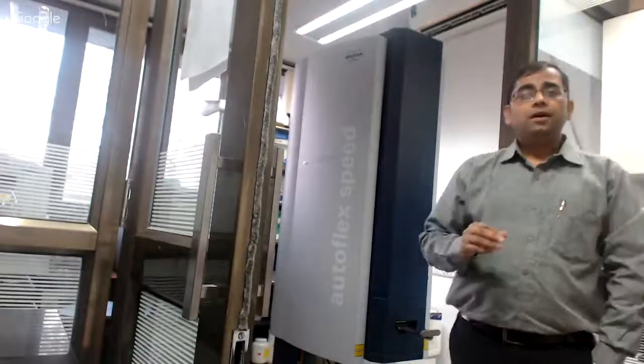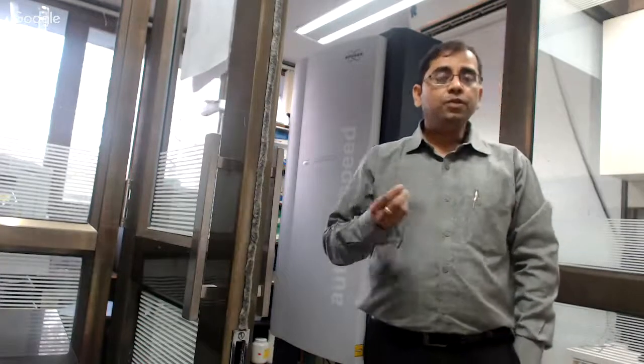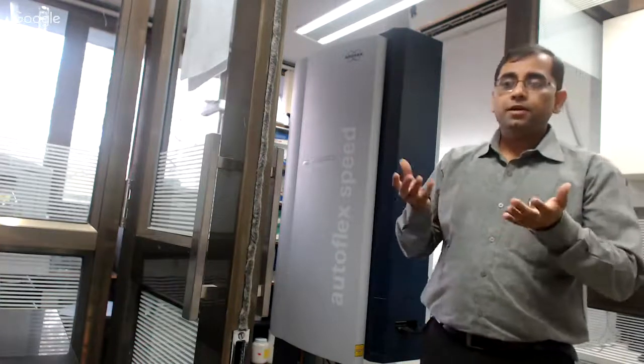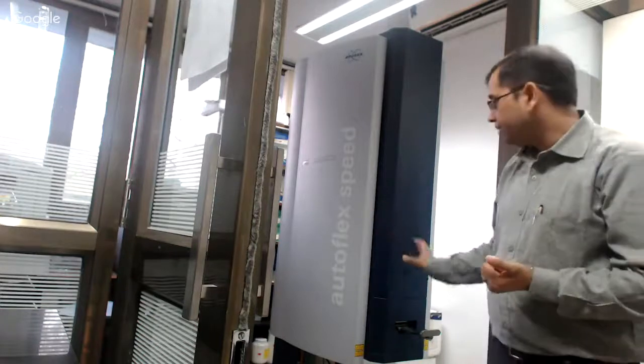So first you start with sample preparation. You take your protein of interest, add the matrix, mix them well, and then place them on the MALDI plate, which is sometimes a 384-well plate or a 96-well plate. On this plate you have your protein of interest, which you want to analyze. You insert it inside this instrument, and then you do a laser bombardment on it.